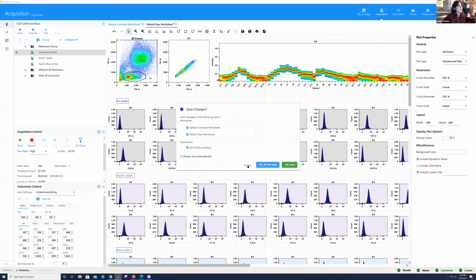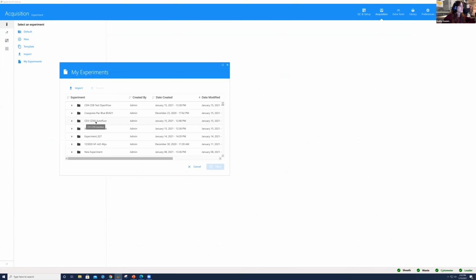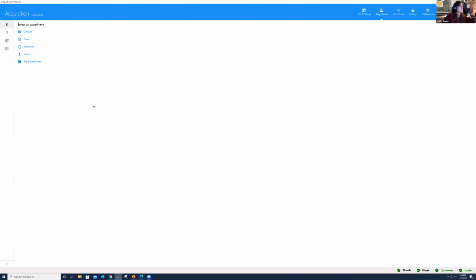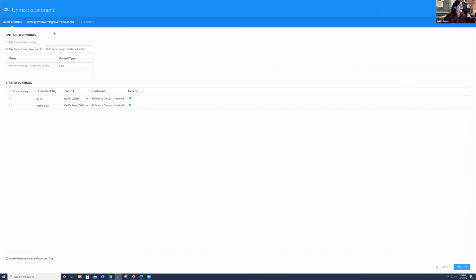So what I'm actually going to do is go into another experiment, right? We did our test a little bit before where we created our CD4, CD8. When you create your experiment and select unmix, I'm doing this to save a little bit of time. The only thing you have to do in order to reduce the impact of autofluorescence and do the autofluorescence extraction is click this button in the bottom left corner.